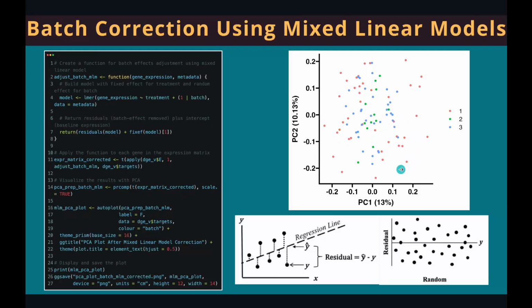As you can see, the results are pretty good. All the samples are mixed well, and you can't even tell the shapes of the different batches. So the rationale is like this. We model the treatment as well as the batch effects, and we only take the residual. What is residual? It's the predicted value on the regression line minus the original value. The residual will have no correlation with the original gene expression value. So we take the residual and add the average expression, which is the intercept in this regression model. We use this new value as our new corrected gene expression value.